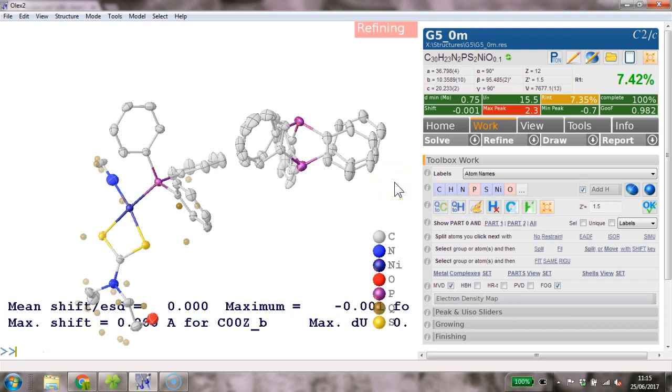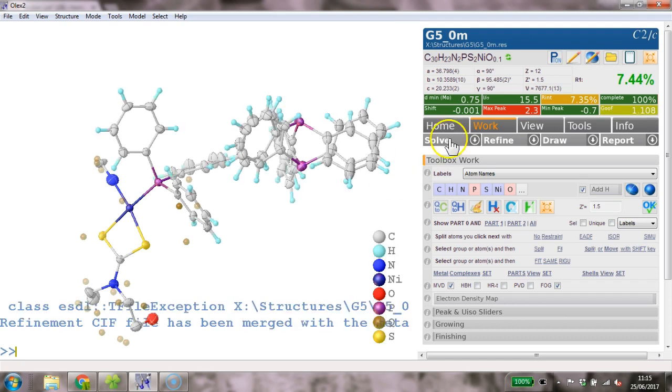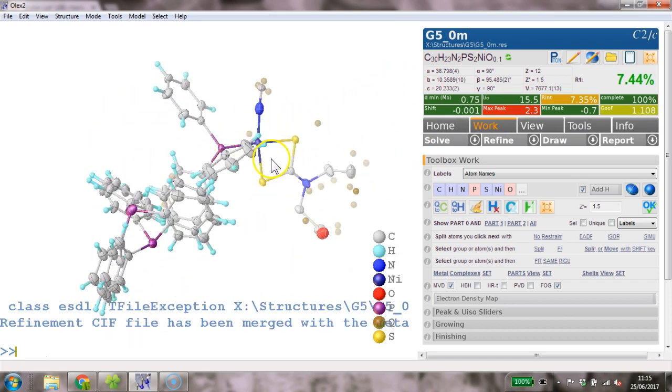I hide the hydrogens with Control and H. So that hides the hydrogens, but doesn't take them out of the list. It does not kill $H or anything like this. That would actually delete them. Okay, 7.44%. That's not too bad.